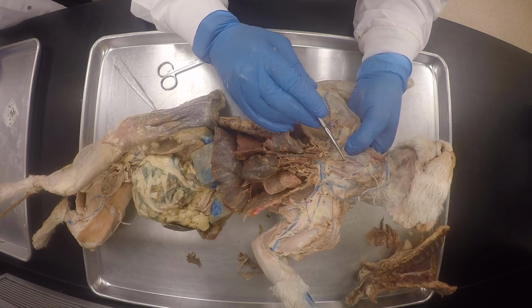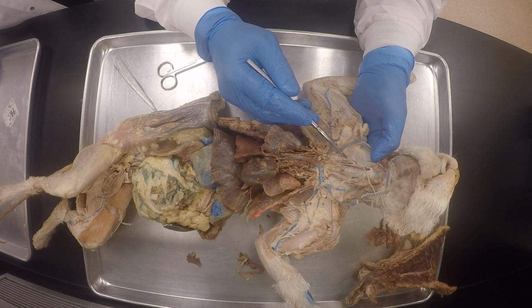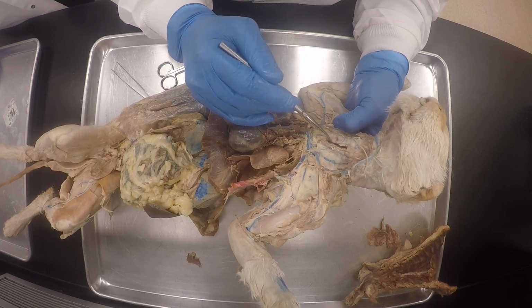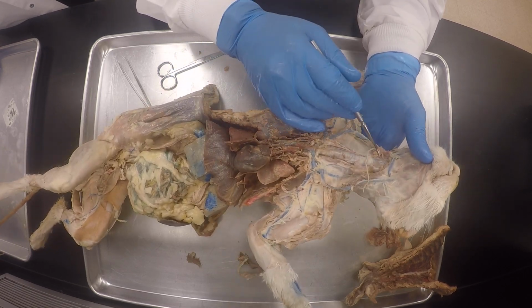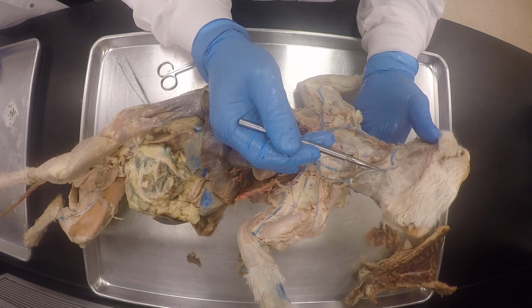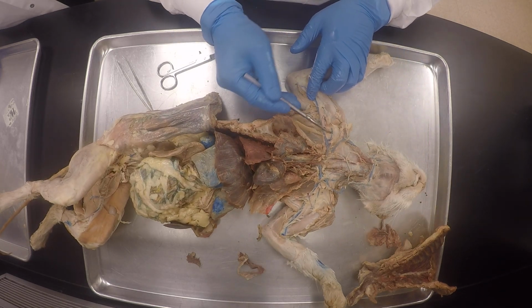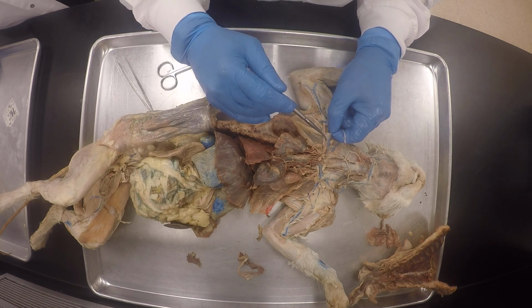Okay? So there's the common carotid artery together with the poorly infused internal jugular vein on the right and then the common carotid on the left. You don't have to say that though, because they are both coming from the brachiocephalic trunk. Okay? And like I said, you don't see where it splits, but you do see the transverse jugular vein, anterior facial vein, posterior facial vein. You see anterior facial vein on this side, posterior facial vein on that side, subscapular vein, subscapular artery. Okay? So this is it.